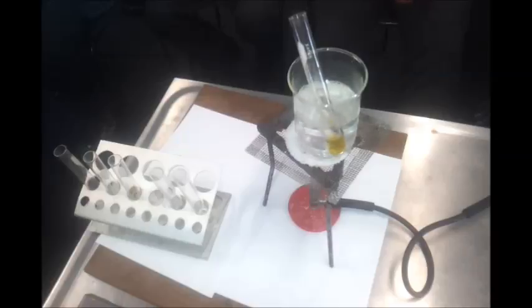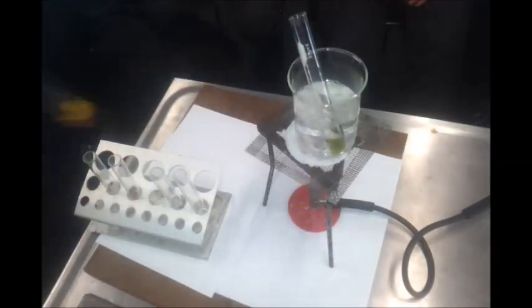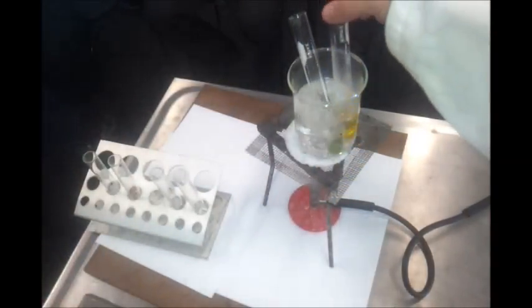While I'm doing that, ethanol is a primary alcohol. It's a carbon with the OH bound to only one other carbon. So therefore, we would expect another primary alcohol to do the same thing. So what I've got is propane-1-ol, and we're going to see if it gets the same reactions as we had before. I've still got a bit of my acidified dichromate there. I'm going to add propane-1-ol, which is another primary alcohol, to this. It's a little bit less soluble, so we see it goes a little bit cloudy in there. I'm going to put that in here and see if it also changes colour.